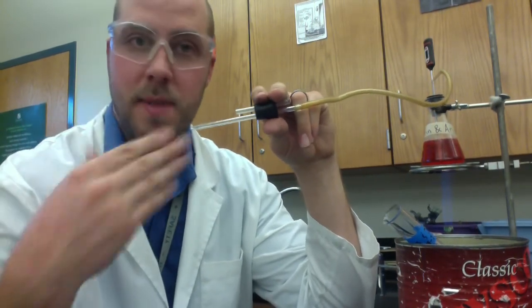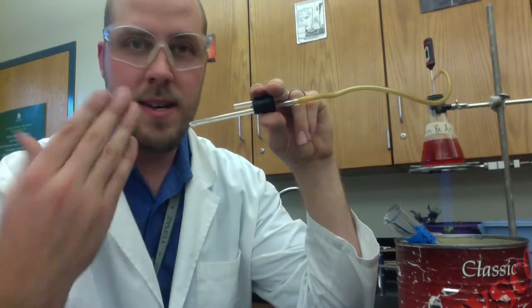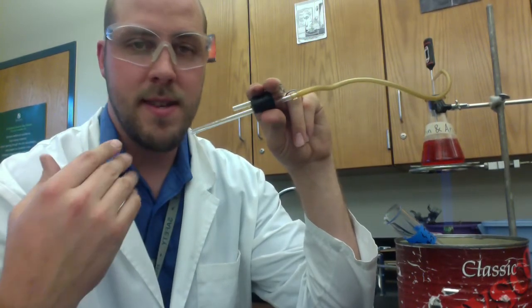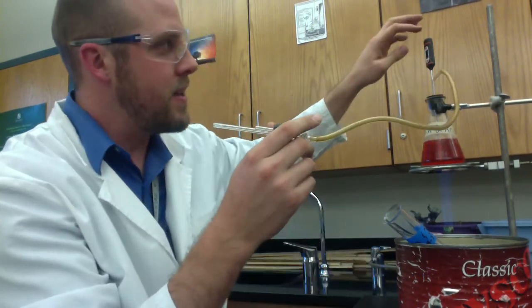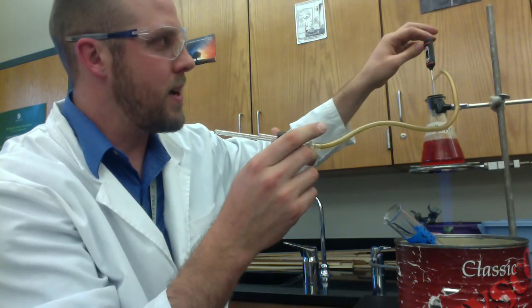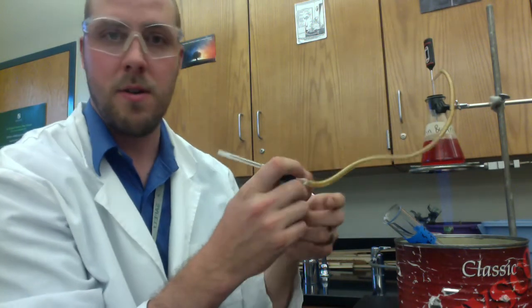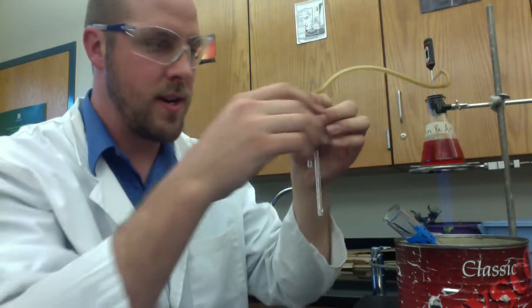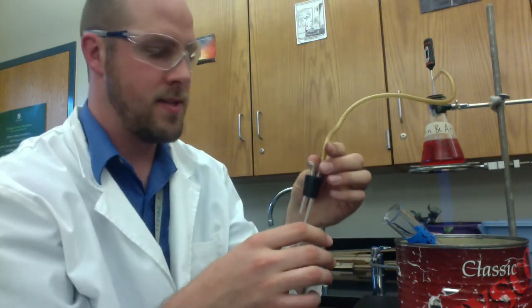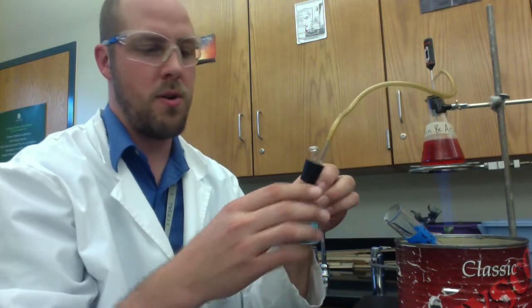Okay, right now I just smelled a very strong distinctive strawberry smell. That means that my fruity ester is boiling off. So I'm going to go ahead and look over here at my thermometer. Hopefully your partner is watching and I can write down what temperature it was that that just happened at. I'll turn my gas a little bit down now actually. And then that's when you put your reaction into the bromothymol blue.